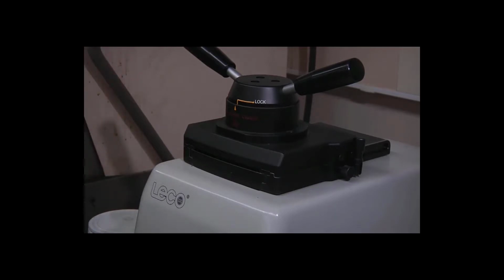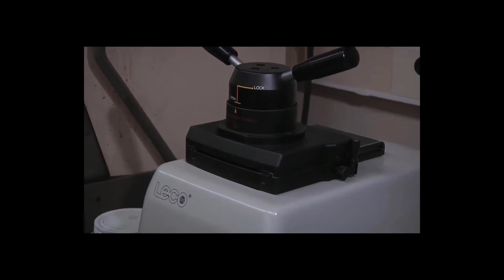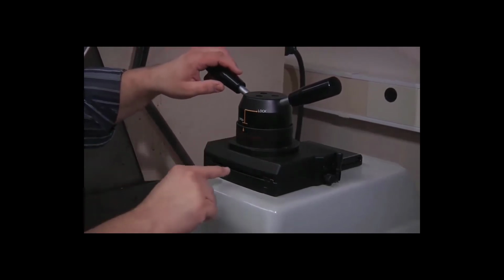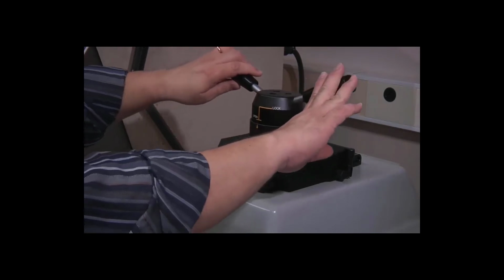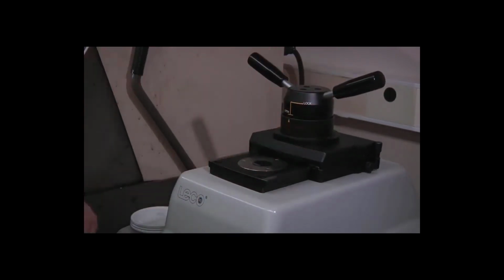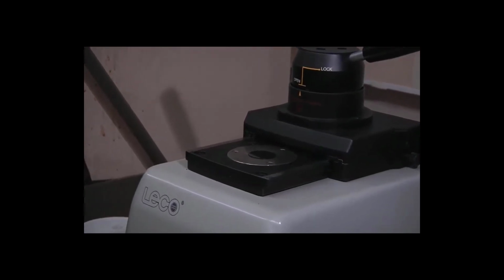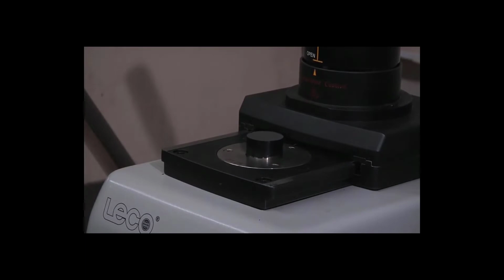So to raise it up, we simply press the ram up button once. That will bring the ram up enough to pop the upper ram loose. If you were to look right between here, we'd just be able to see the top of the puck. Push this back. Now you can see the very top surface of our puck. Press the ram up button one more time. It will bring the puck up to a height where we can remove it.